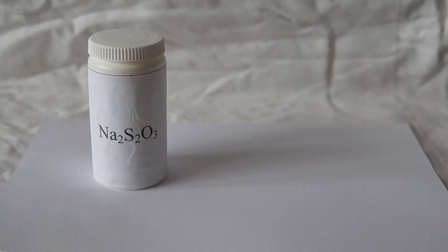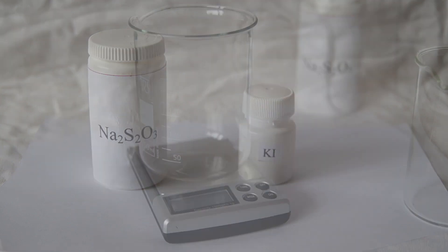Hello everyone! Today we'll have a very unusual chemical reaction called Egyptian night or the simplified version of the chemical pendulum.